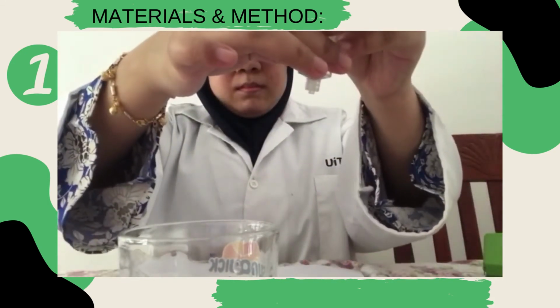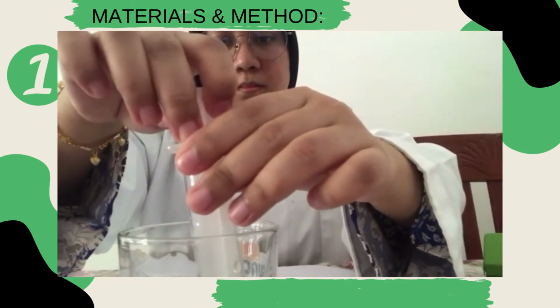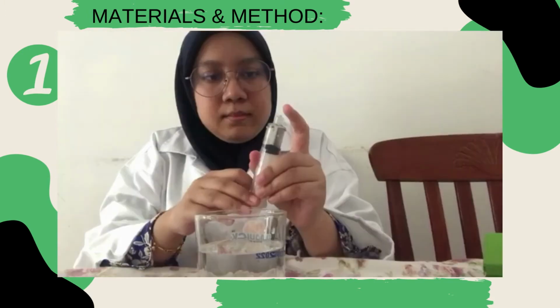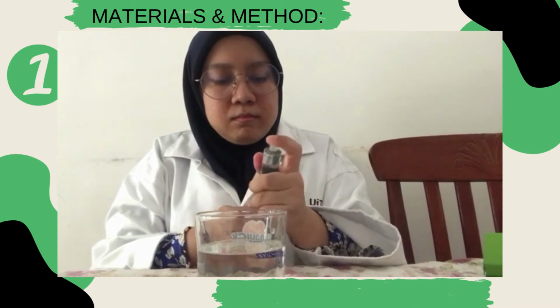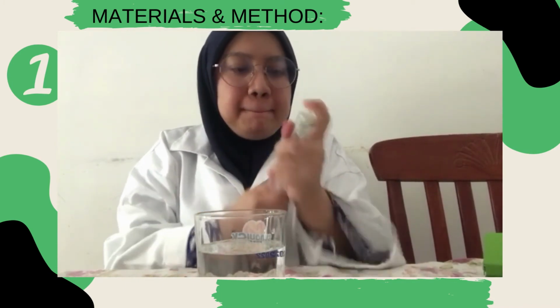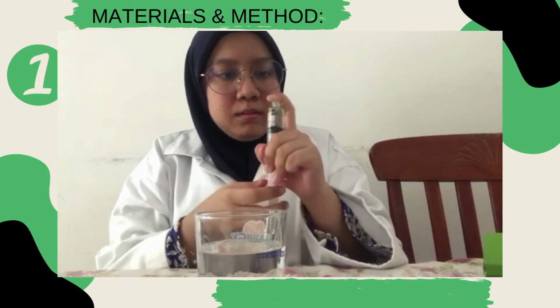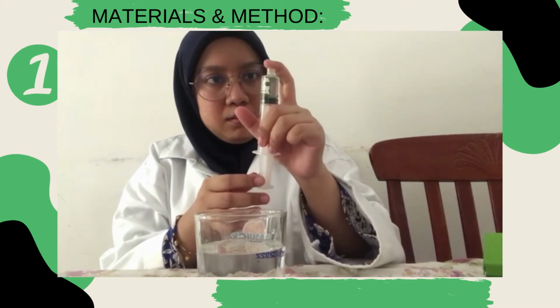Hold the syringe with the tip up and expel the air by gently pushing on the plunger and shaking it. Plug the tip of the syringe tightly with your finger and gently pull on the plunger, creating a slight vacuum. While you pull the plunger, be sure to shake to make sure the air bubbles come out. You should see tiny bubbles coming out of the leaf discs.